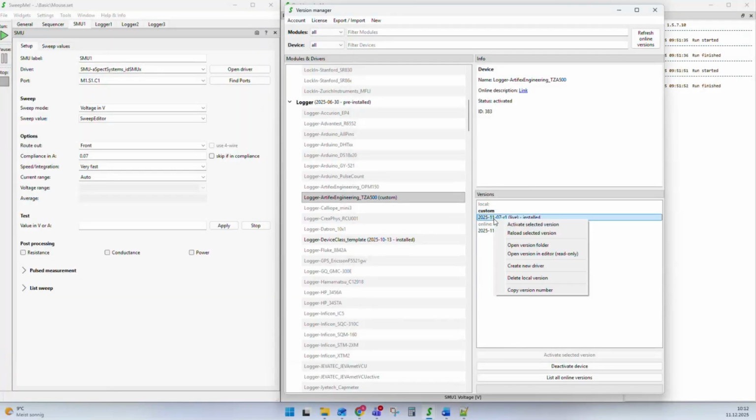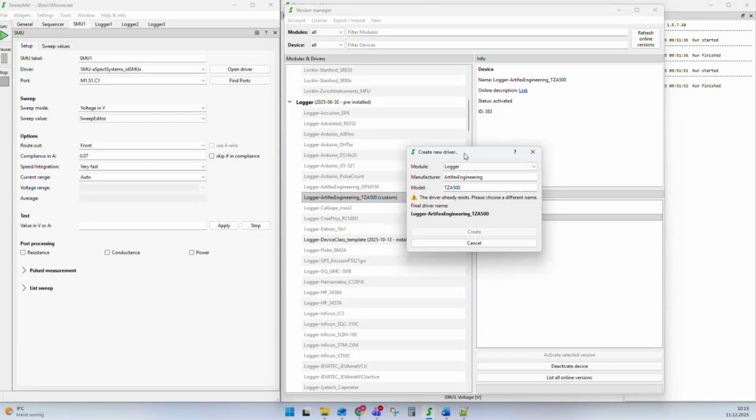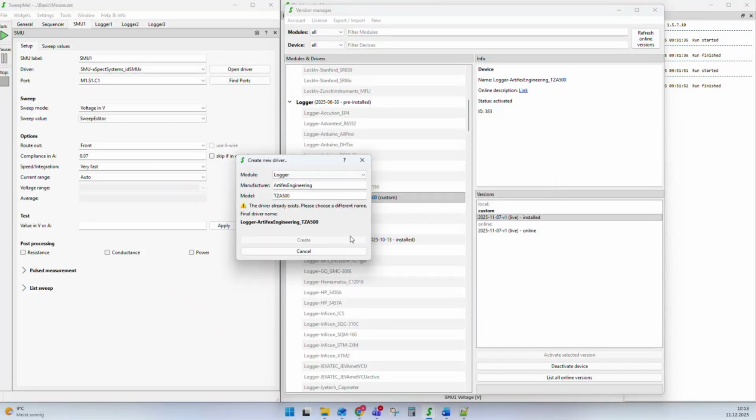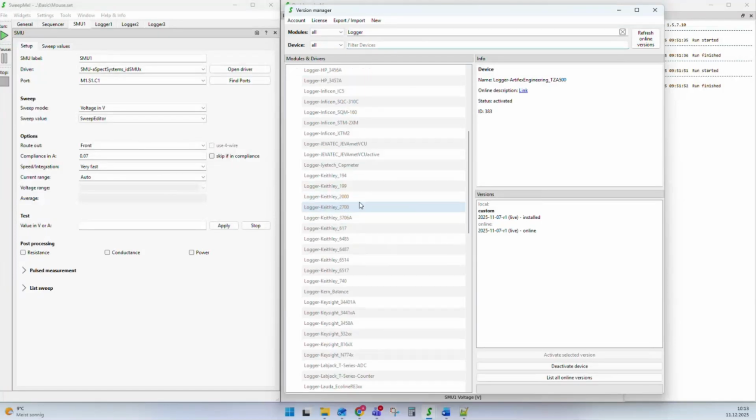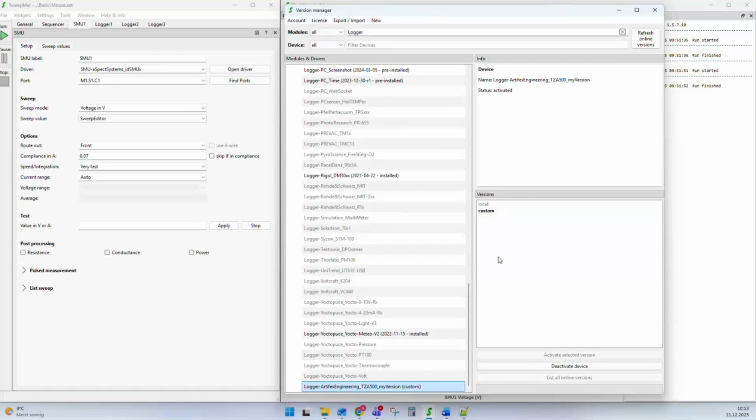The next option is to create a driver from an existing driver. So here we also have this option, create new driver. If I create a new driver, I can make a completely new driver with a new name. This name is already given, but I can change TZA 500 and call it my version. And I create it. So now I have here for this instrument a new version, and this is my own version. There is no version on the server. I can again modify this driver and make a customization. This is recommended when you want to make something very special, and when you add features that you cannot share with the community because they are very specific to your setup.